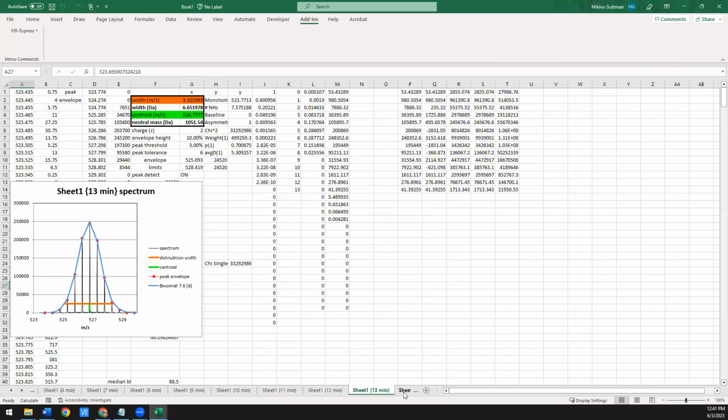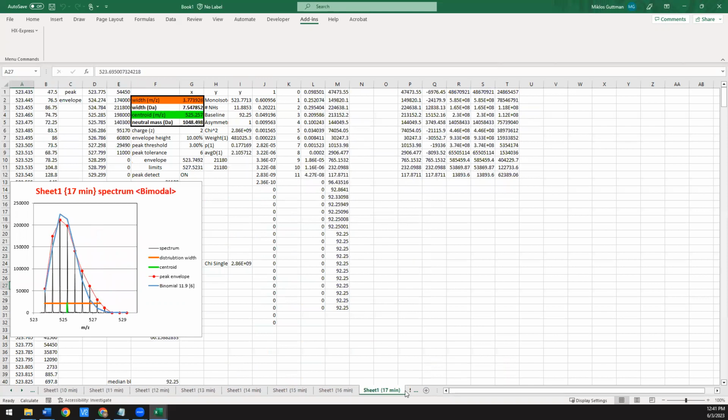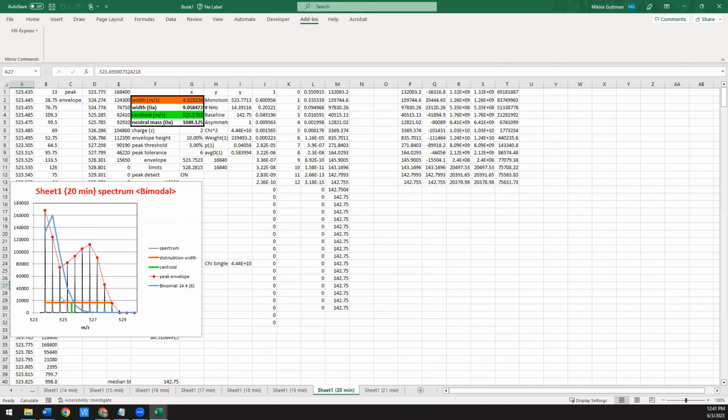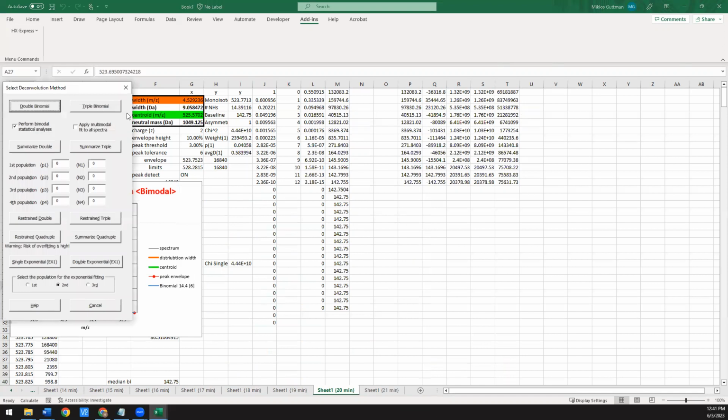So one last example I'm going to talk about is going to be here towards the end. And this is going to pertain to what if you have more than two species in there? So we're going to take this data, which kind of looks like a mess. It's definitely got more than one thing in there. You can already tell from the number of amides. We're going to try the first step. We're going to do a double fit and see what we get.